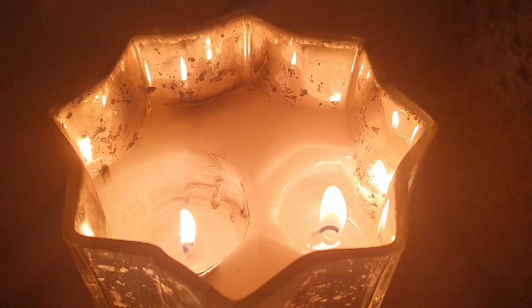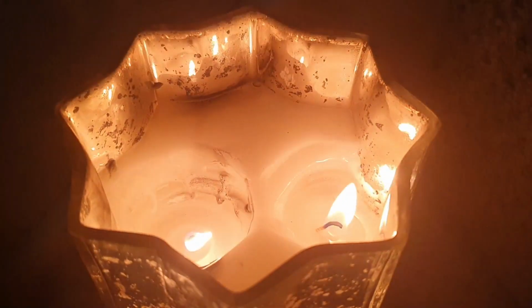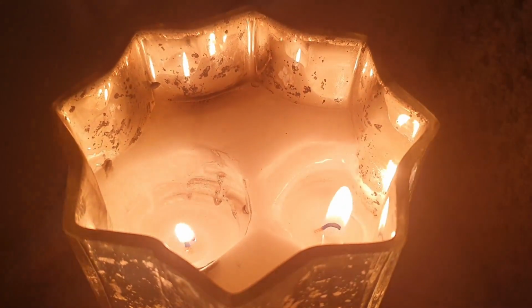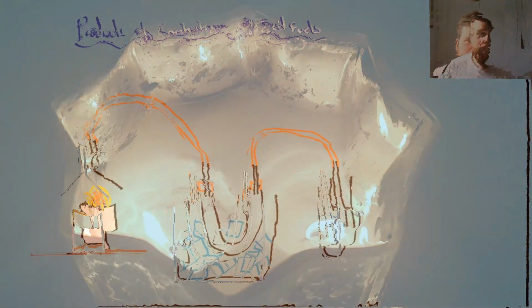Well, what I'm going to be talking to you about in this video is the little experiment that we can do to show and prove what the products of combustion are. So, let's get straight to it.